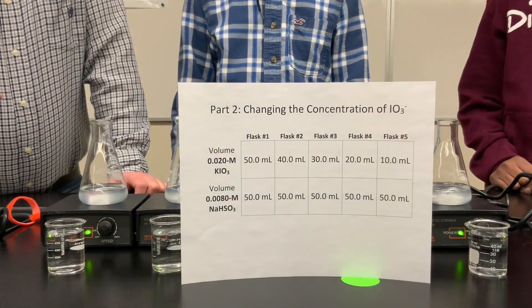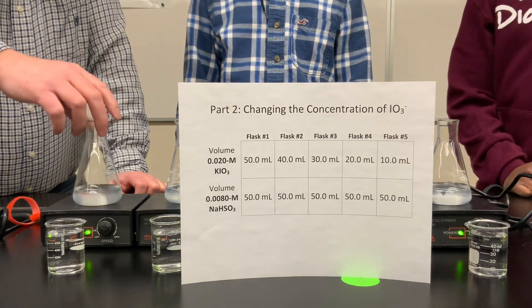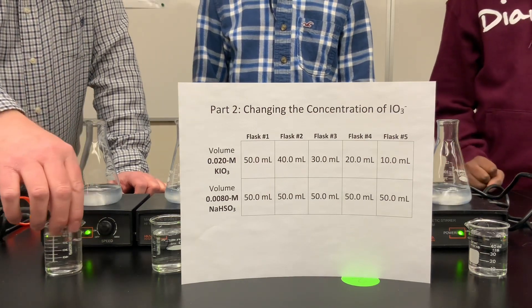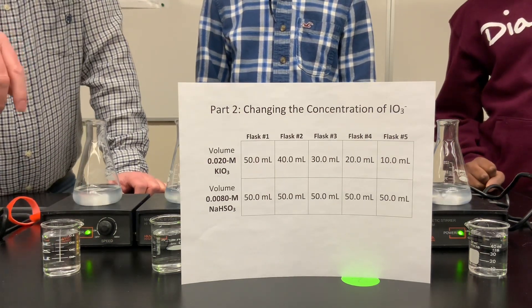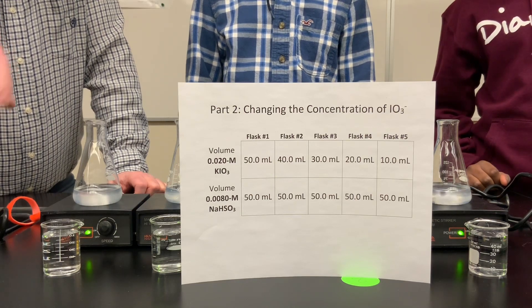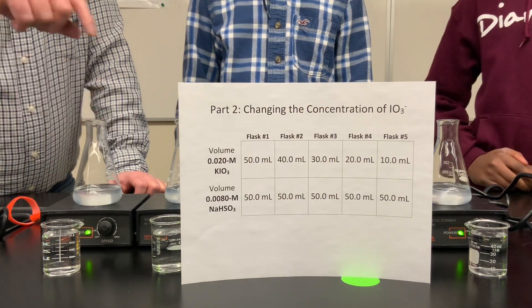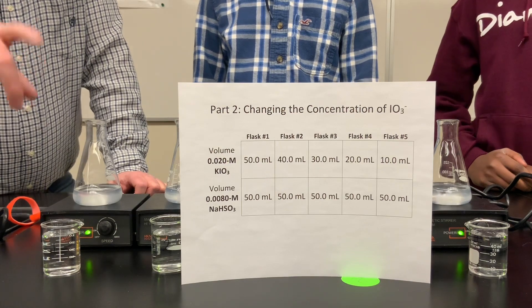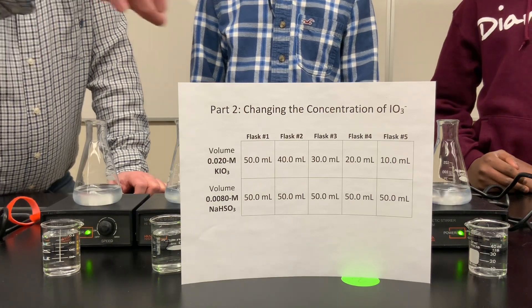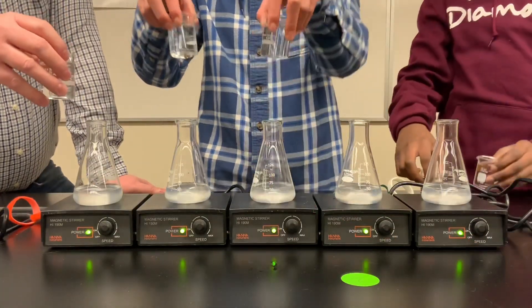We've reset for part two of this kinetics experiment. This time we have five flasks, each with 50 milliliters of 0.008 molar sodium bisulfite. In the beakers, we have decreasing amounts of the potassium iodate solution, each topped up to a total volume of 50 milliliters, just like in part one. Using dilution calculations, you can calculate the concentration of potassium iodate in each beaker. When combined with the flask contents, it will be diluted again.